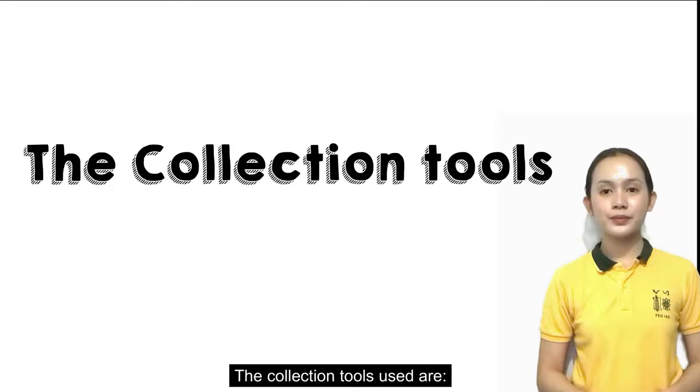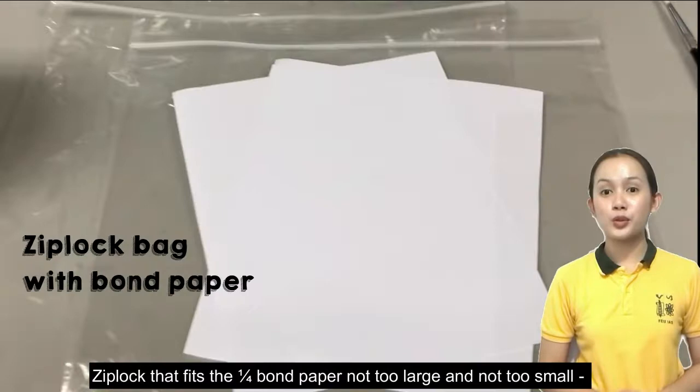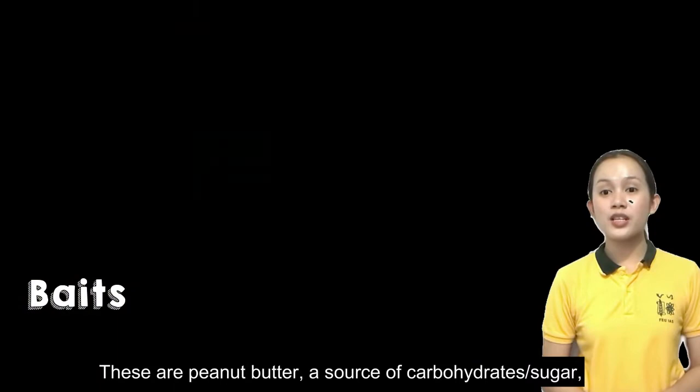The collection tools used are: first, we have the 1/4 bond paper, and this is where the bait is placed. Next, we have the Ziploc bag — not too large and not too small — because this is where the bond paper with the collected insects will be temporarily placed after collection. Next will be the baits for luring insects: peanut butter, a source of carbohydrates or sugar, and tuna or sardines, a source of protein.